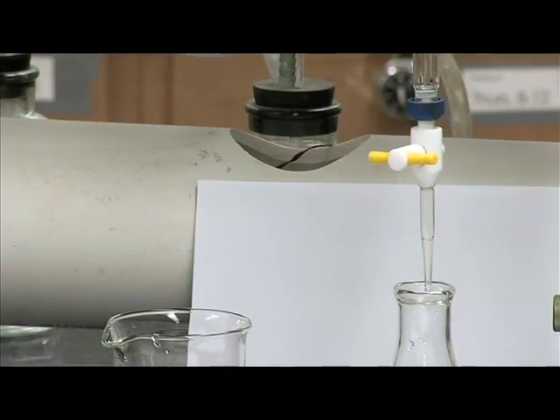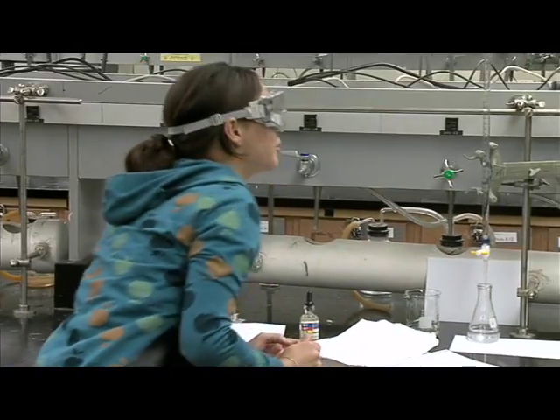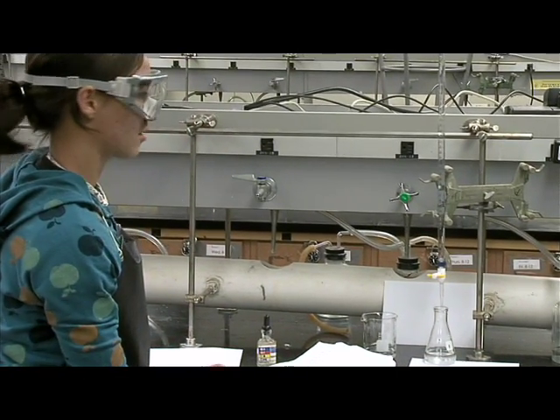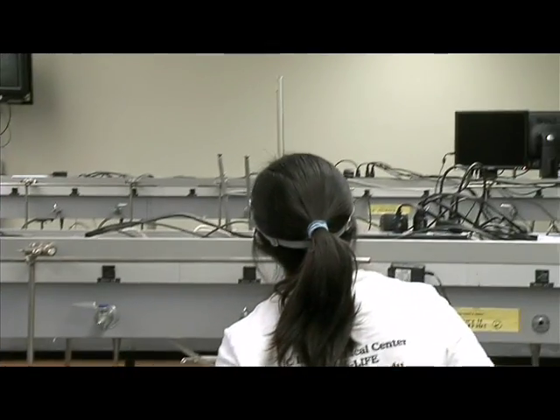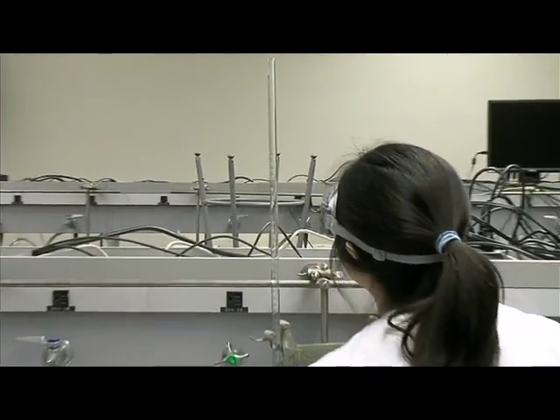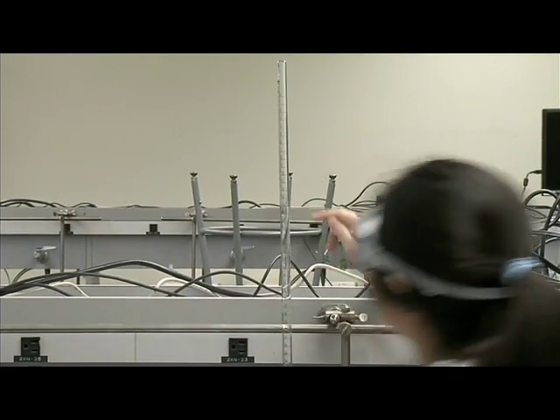Okay. It says to find the volume of the titrant that we used. Okay. It says about 14.10 milliliters. Okay, I'll write that down.